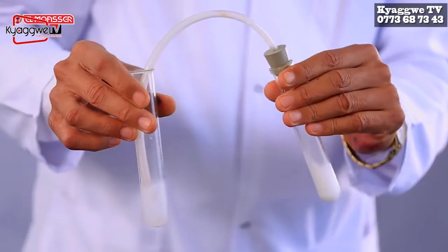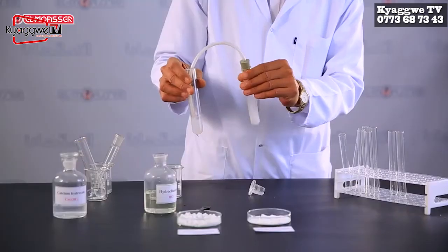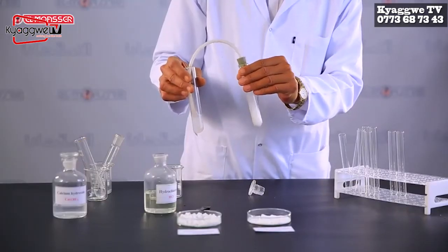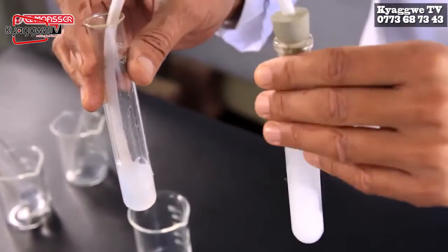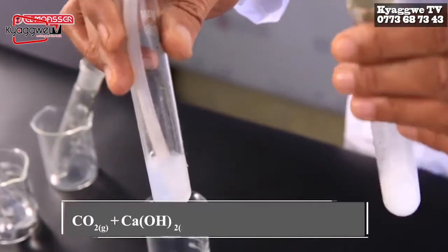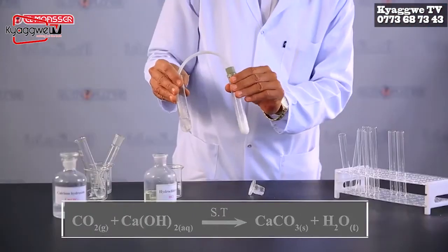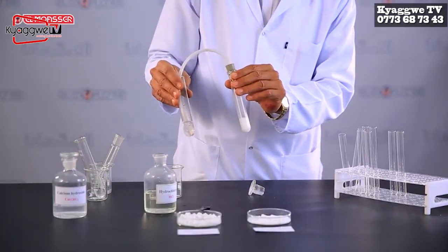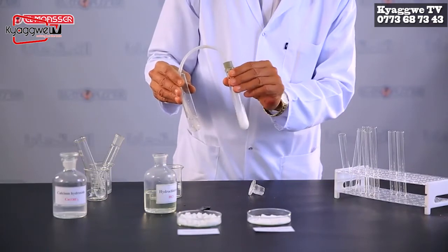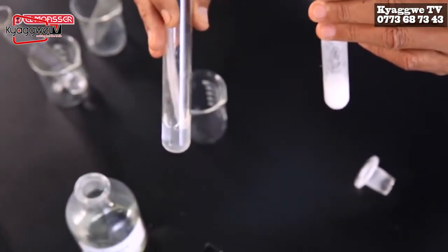Clear lime water turns milky on passing carbon dioxide gas through it for a short time due to the formation of sparingly soluble calcium carbonate in water. On passing carbon dioxide gas for a longer time, the precipitate disappears, since insoluble calcium carbonate changes into soluble calcium bicarbonate.